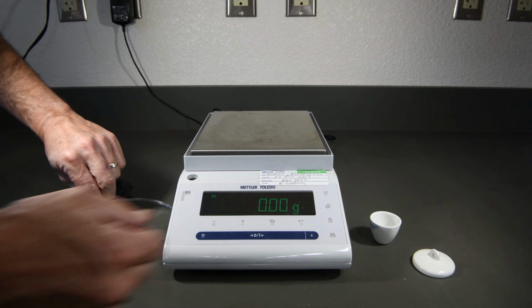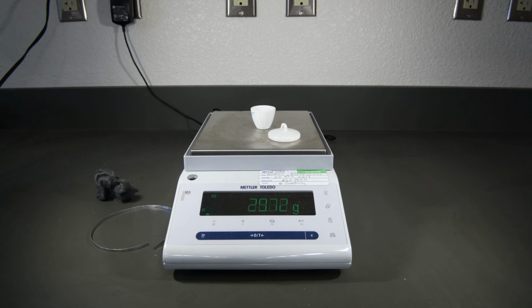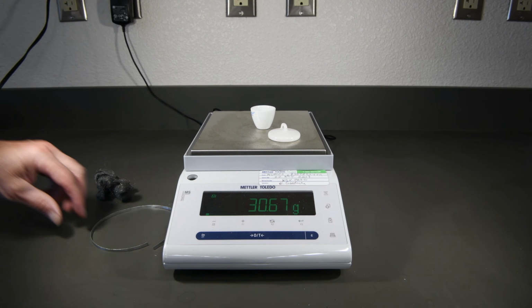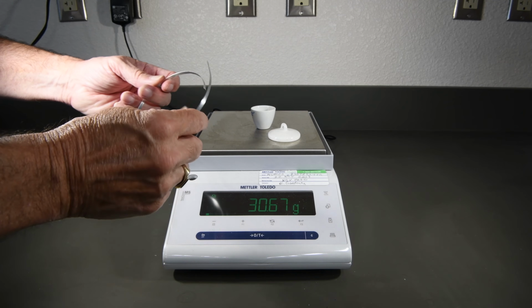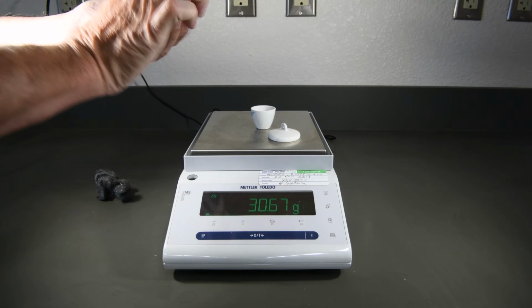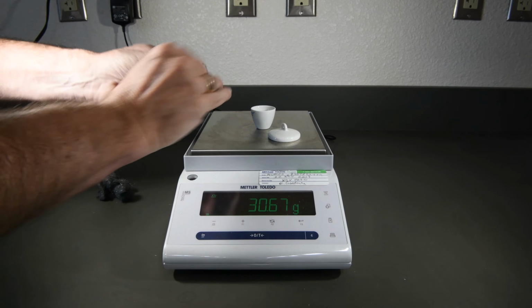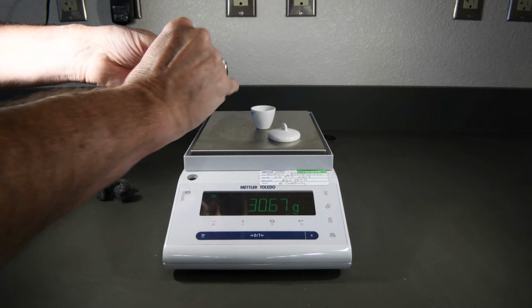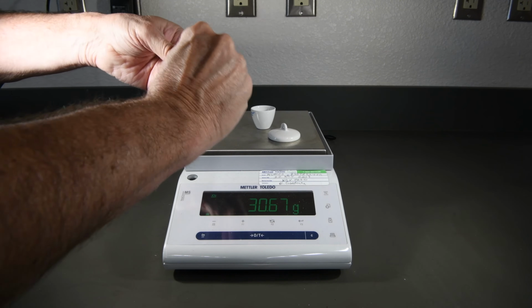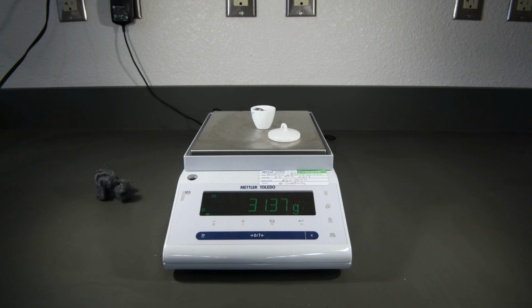Now we can go ahead and return our crucible and cover to the balance. And then before we can place the magnesium in the crucible, we're going to need to crumple it up into a loose ball, like I showed you during the pre-lab introduction. So you want to wad this up until it fits in the crucible, but still leave it open enough so that air can get in, because we need to make sure we thoroughly burn the magnesium ribbon. That looks like it's going to fit very nicely, so simply record the mass of the crucible and the cover and the magnesium.